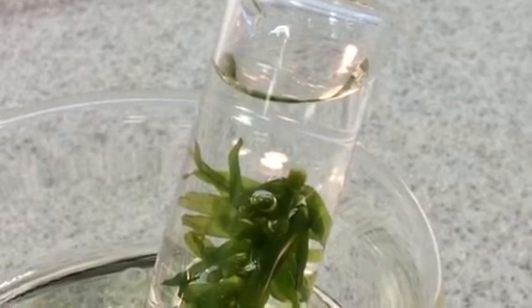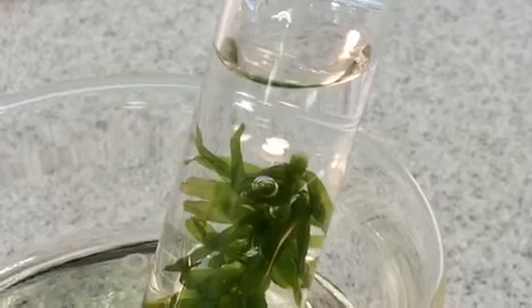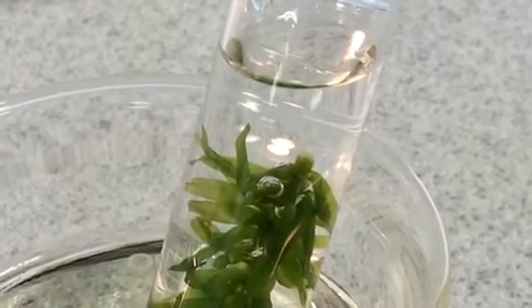You can see it's going quite slowly, but they are coming out there, the oxygen bubbles. So let's imagine we've done that for 1 minute. So we have some results here. At 50 centimetres, our first trial, we got 17 bubbles in 1 minute.